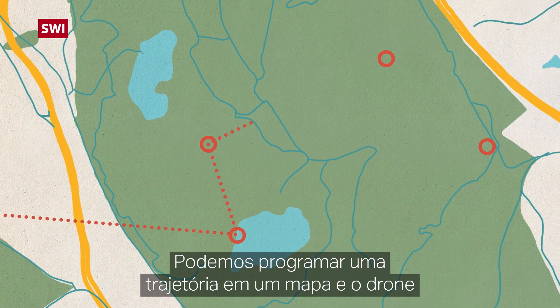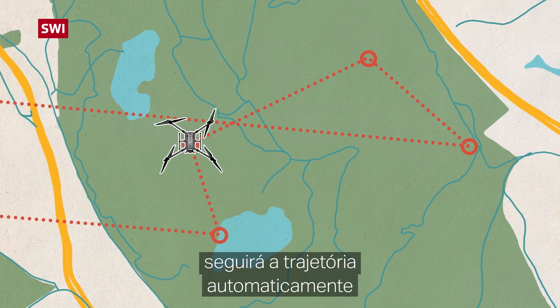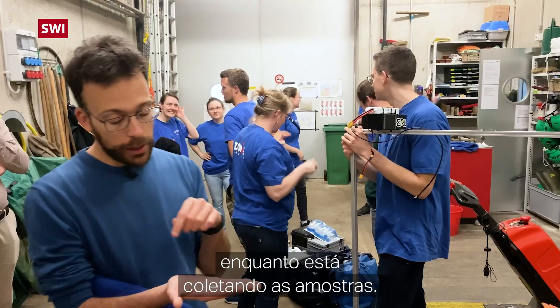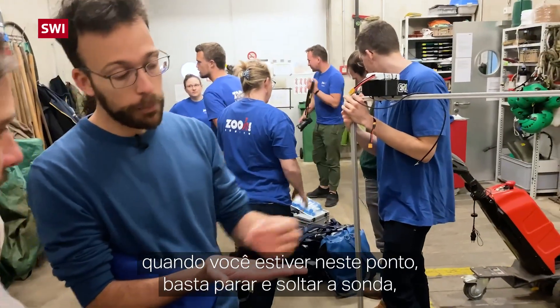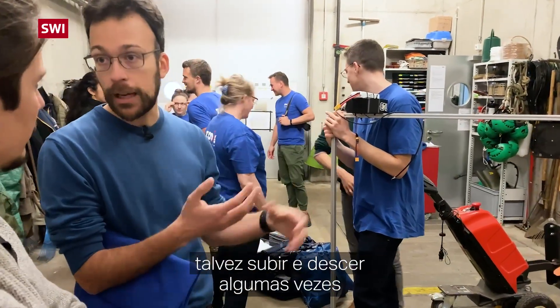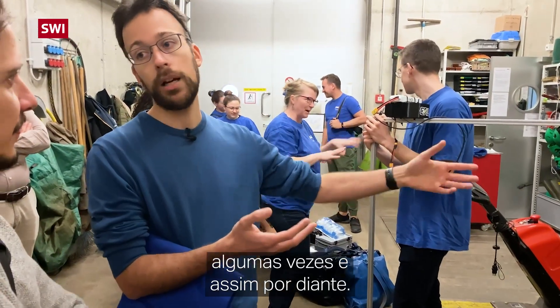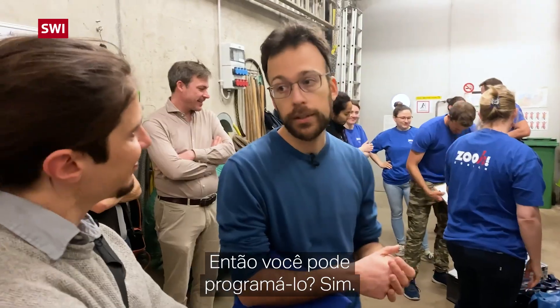We can program waypoints on a map and the drone will actually follow the trajectory by itself while sampling. I would like to tell the drone: when you are at this waypoint, just stop, then drop the probe, go up and down a couple of times, and then move to the next waypoint and go up and down a couple of times, and so on. So you can program it? Yes, yes.